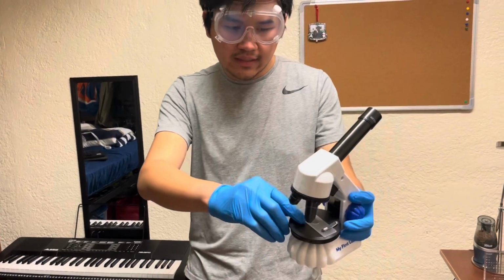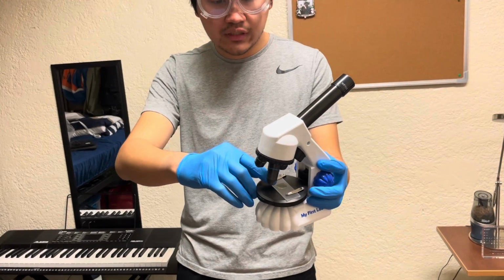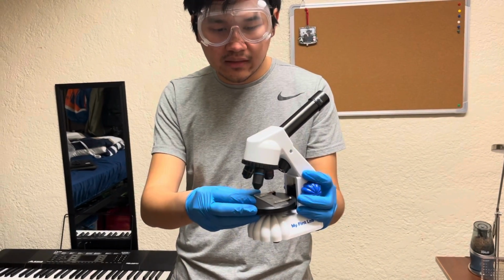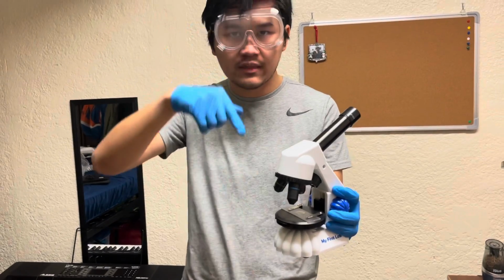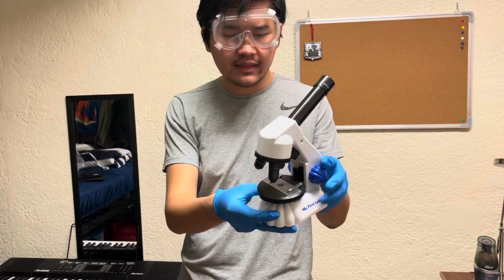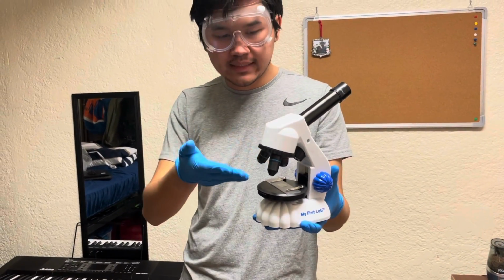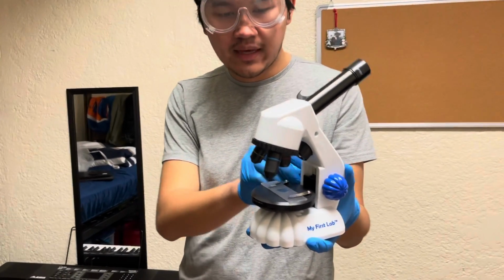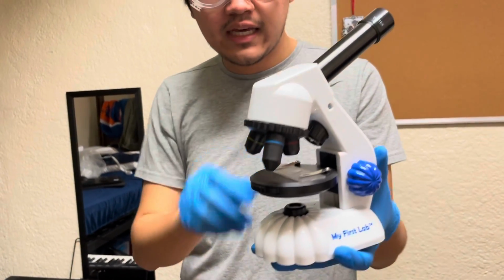Note, keep in mind the diaphragm in the middle of the stage has to be lined up with the clear portion of the microscope slide. That is so that the water sample that you have is centered with the diaphragm, so it's aligned with the objective lens, as well as the light that shines from underneath it. So now that you've lowered it all the way and placed the microscope slide, you're going to use your coarse adjustment knob and raise the stage all the way up.